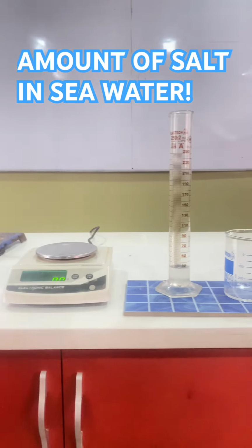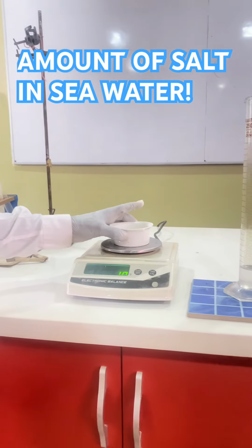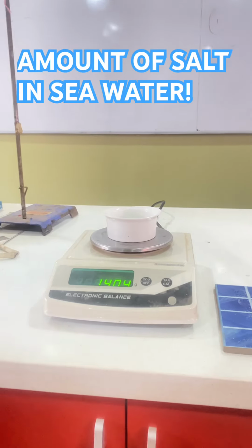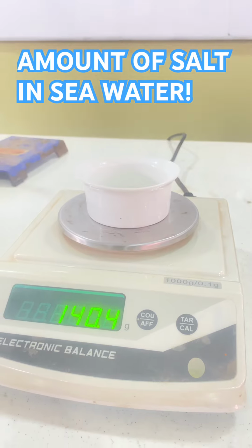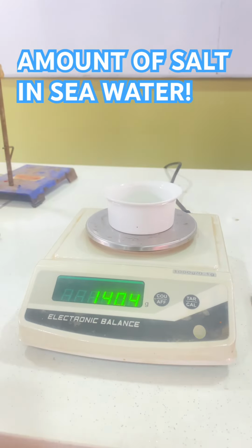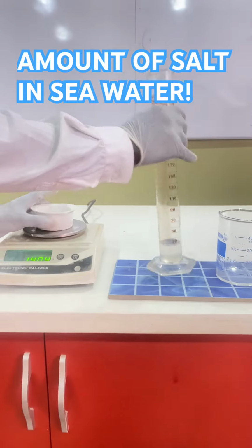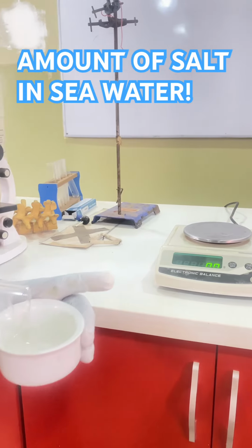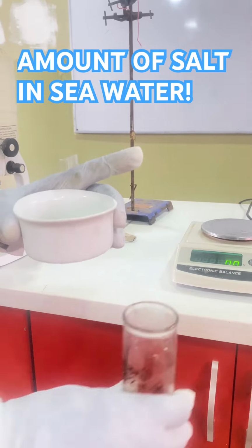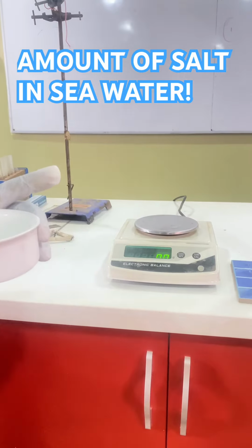Now to do that, we first take our evaporating dish and put it on the scale to weigh its mass. So the mass of the evaporating dish is 140.4 grams. Let us approximate it and make it 140. Now we are going to transfer the whole salt solution into the evaporating dish. Then we are going to set the whole thing onto a Bunsen burner with heat so that evaporation can take place.